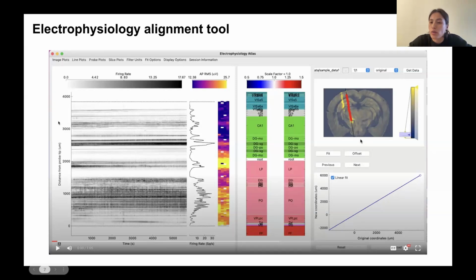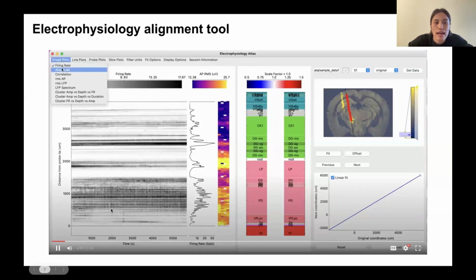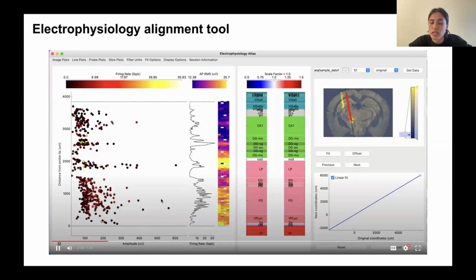We also show a coronal slice, which is useful to see sometimes the channels in the anatomical context, because sometimes with these 2D interpretations, you can lose track of the actual anatomy itself. So on the top, we have these menu options that allow you to change the plot that's being displayed. So we're showing the cross-correlation of activity, the RMS of the LFP band, and we also have these single unit displays where you can click on the individual clusters or neurons and see their waveforms and also their autocorrelograms. And so looking back to Julie's talk earlier, you can look for characteristic waveforms, for example, axonal ones in the fiber tracts. And these are different features that you can look out for.